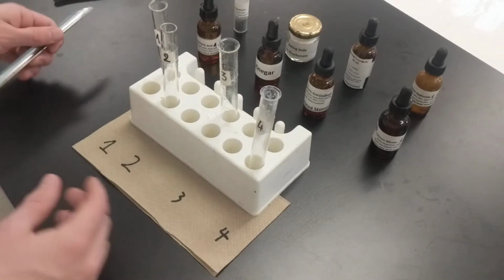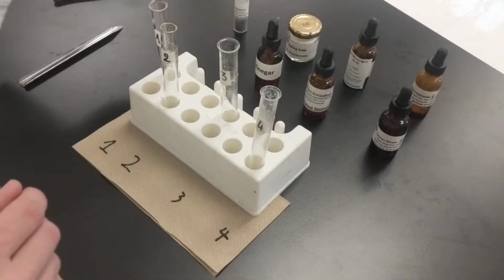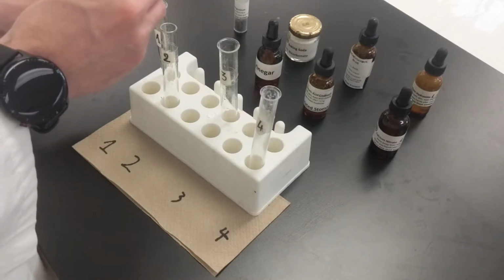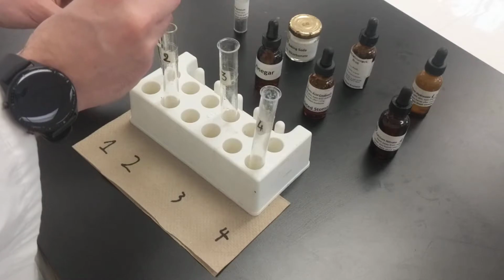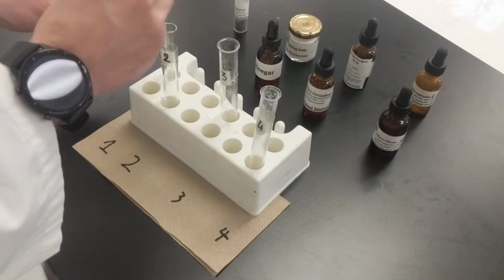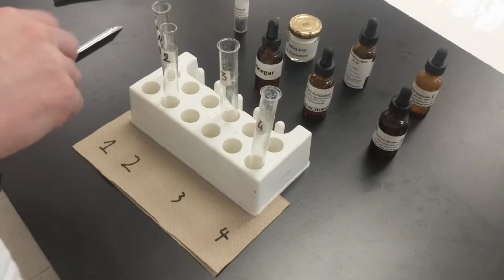Now the next step of the procedure is that per test tube, we're going to be putting some chemicals into each of them. Step 2 says add 2 full droppers of hydrochloric acid. So I'm going to do that right now into test tube 1. Hopefully you can see my numbers here. 1, 2, hold on. Full medicine droppers, not 2 drops. 2 droppers, so that's 1, sorry, I didn't read it correctly, and 2. Okay, that's hydrochloric acid, that's done.